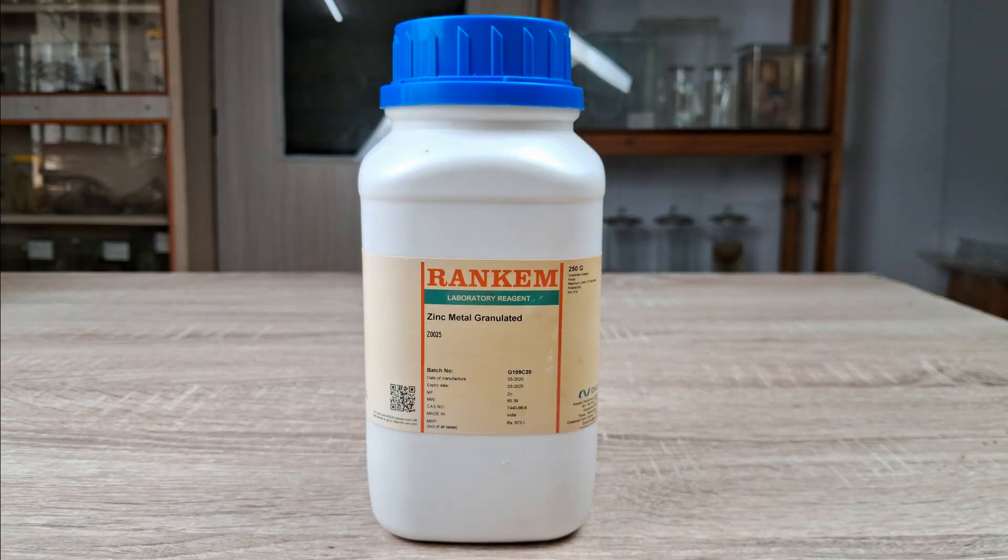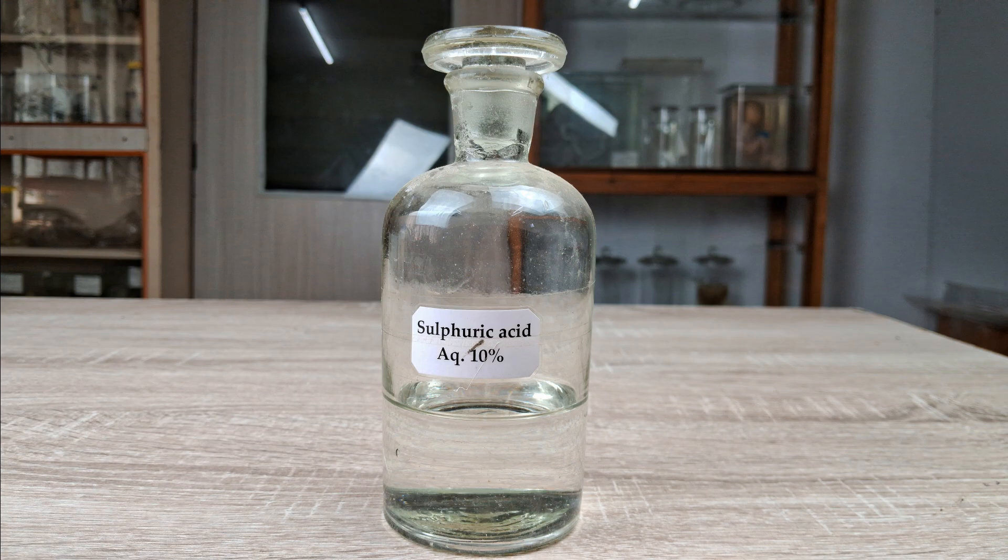Zinc granules. Dilute sulfuric or dilute hydrochloric acid. For this experiment, I'll be using dilute sulfuric acid.